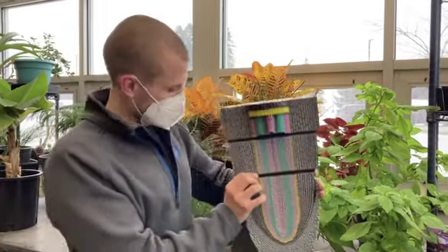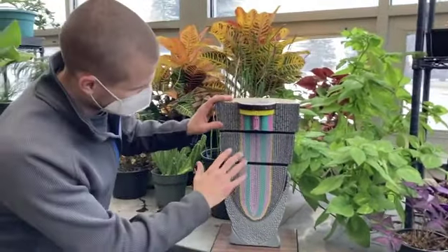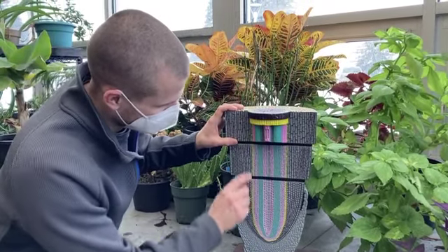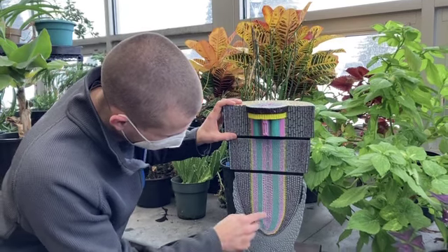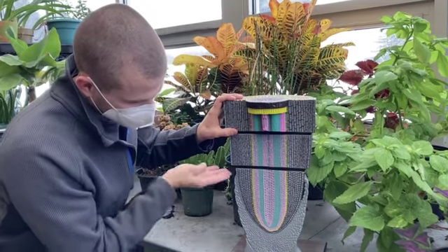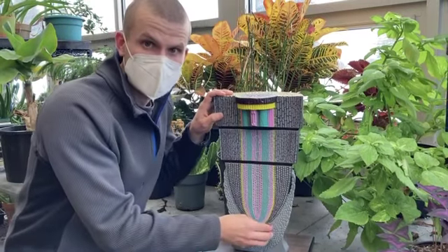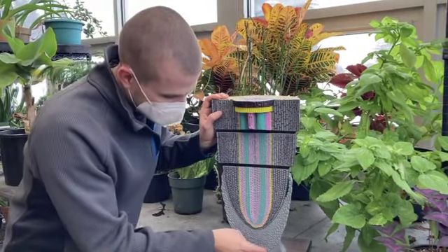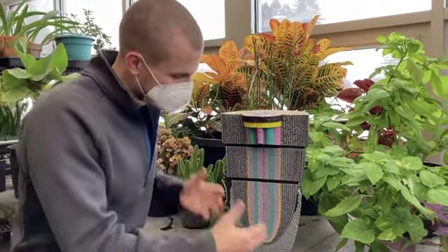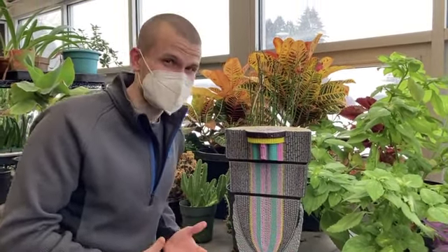Then we turn sideways, and you'll notice different regions of growth here. So the xylem again is in pink as it differentiates, as it matures. Our phloem is in teal here, with some of our nuclei also stained in teal. On the base of the root, you'll notice a region that does not have cell staining. This here is our root cap. The end point of the root cap is actually dead at functional maturity. Because as I mentioned in lecture, this is a piece of the root that needs to help buffer the digging process. Because essentially the root is going to be digging with its face.